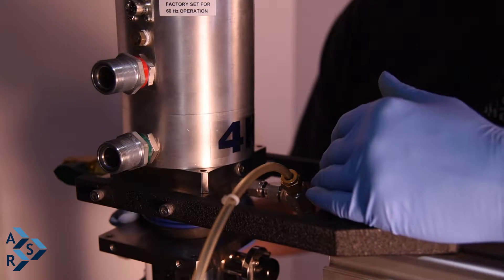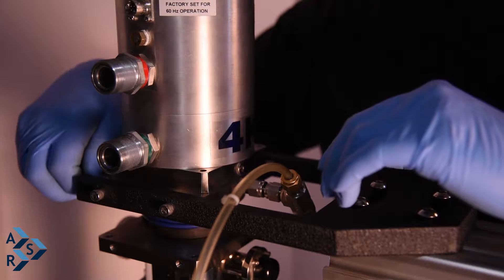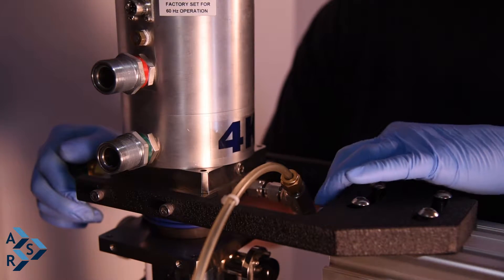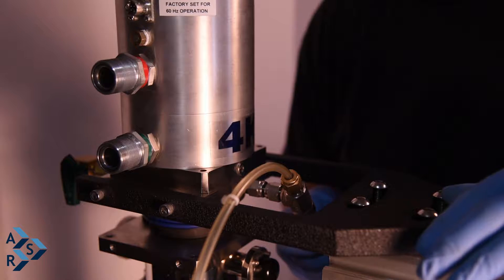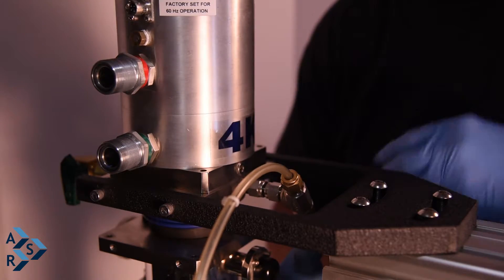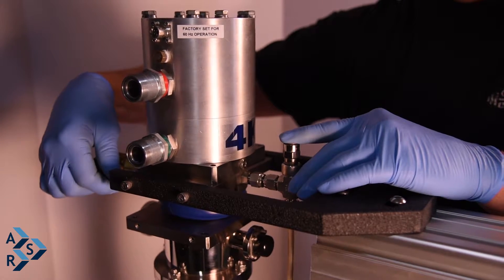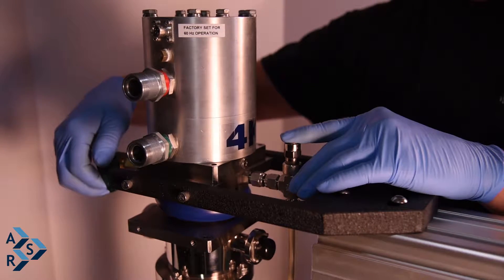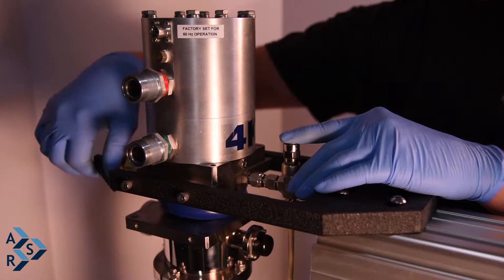There's a valve — close it, and then charge your gas through into the bellows. On the bottom where the relief valve is, it's a poppet: if you pull it the gas will come out, but if you put your thumb on and close it, it'll expand your bellows. Set your regulator for maybe 2, 3, or 4 PSI, hold the poppet shut, close your valve and the bellows will expand. Then relieve the pressure and open this valve about five times.